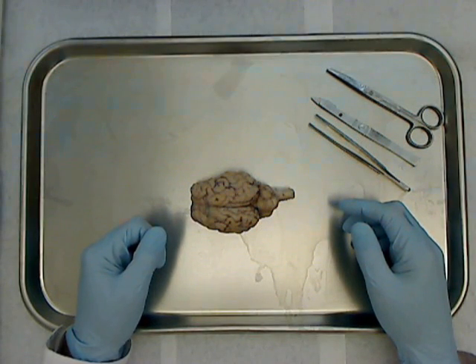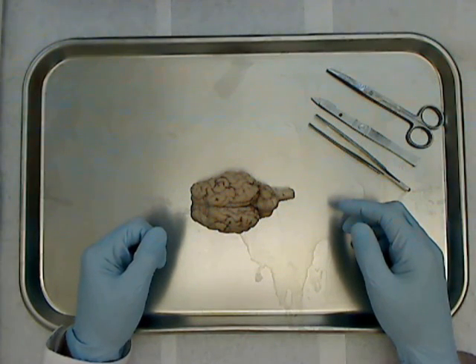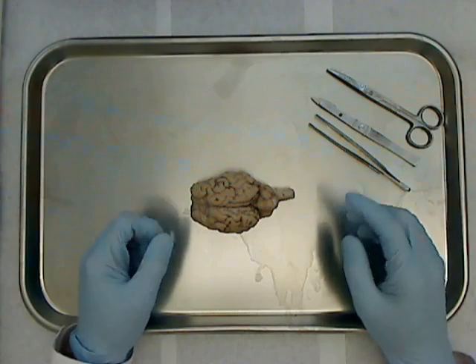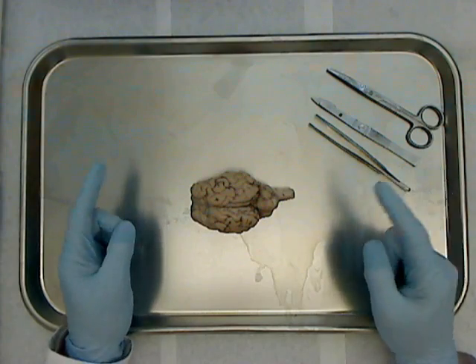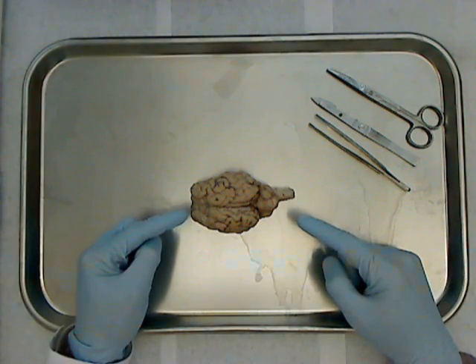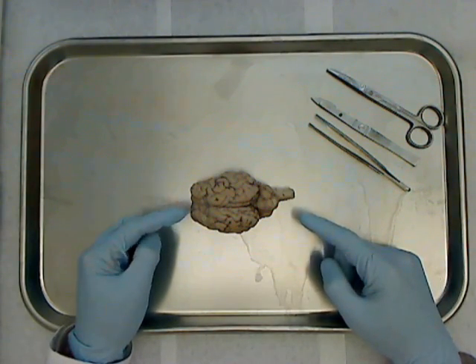Welcome to Anatomy and Physiology at Glen Elks Community College. I'm Dr. Ren Hartung, and for this video we're going to look at the anatomy of the sheep brain.